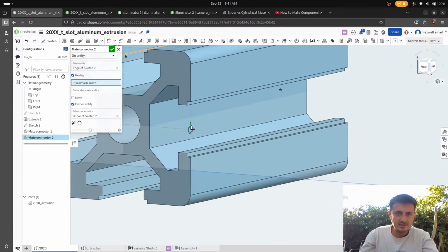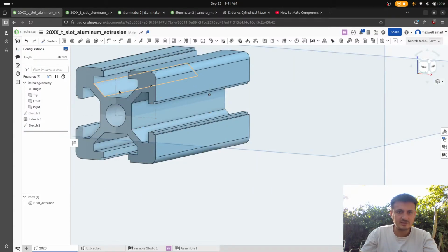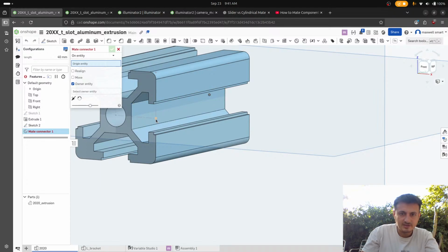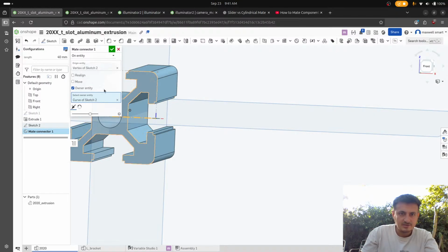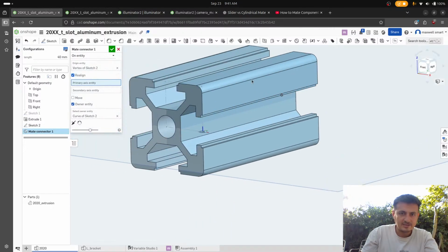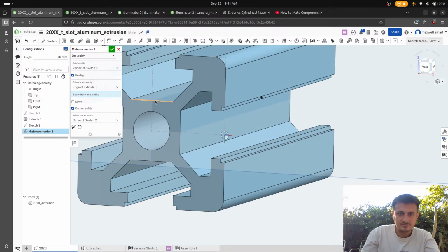So wait, let's delete both of them just so we understand what the hell is going on. So if I selected like this line and then I did Control M and then I clicked on this, mine didn't point forward. So there's that. Realign, primary axis entity. I feel like we want it to be that way. And then secondary axis, we want it to be this way. And then we want to flip it.